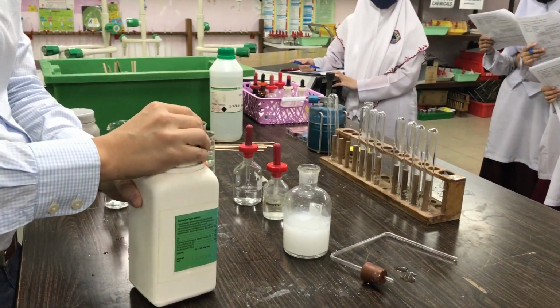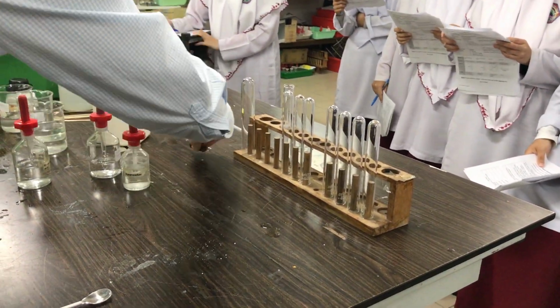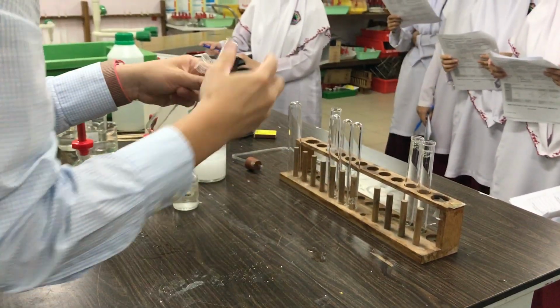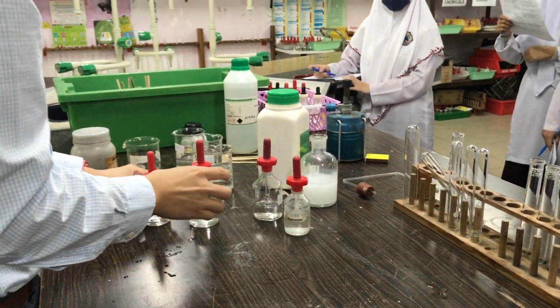Okay, what's the next ion? Chloride. Okay? Chloride, bromide, iodide. You did it when we did group 7 chemistry. So chloride, bromide, iodide, I'm going to do them 3 in one go because they are going to be similar, okay? Now, test for chloride, bromide, iodide.